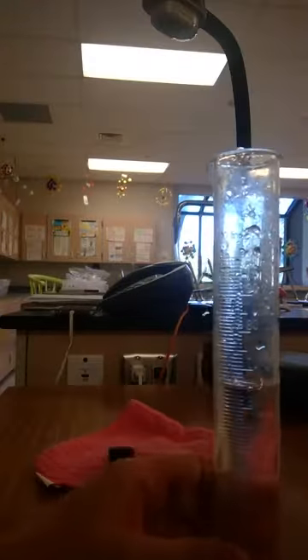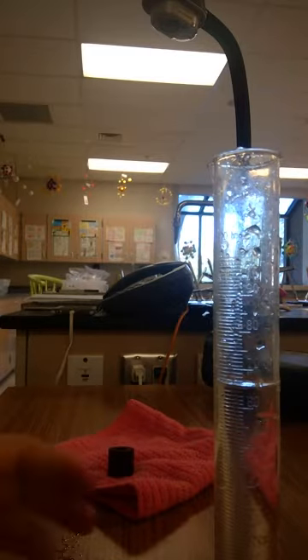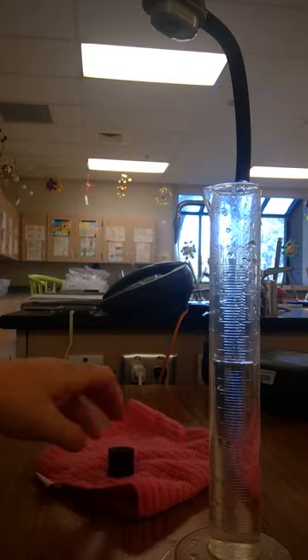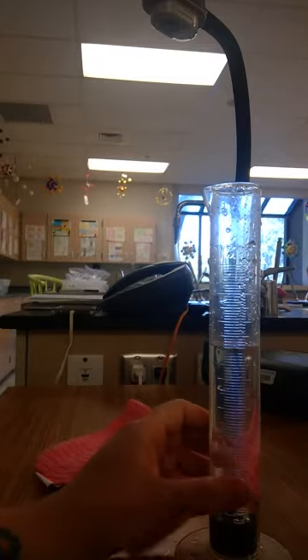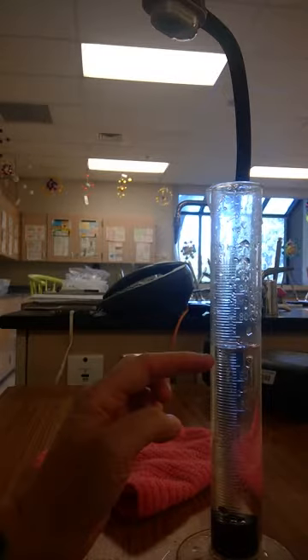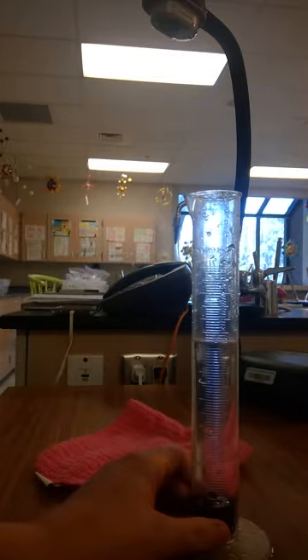Now we're going to work on our third strange looking item. So again, we start with a beginning amount. And so I have 65 milliliters in here. And our displaced water, that's an important vocab word. When I place this in here, our water level now looks about like 70. So 70 milliliters is our new one.